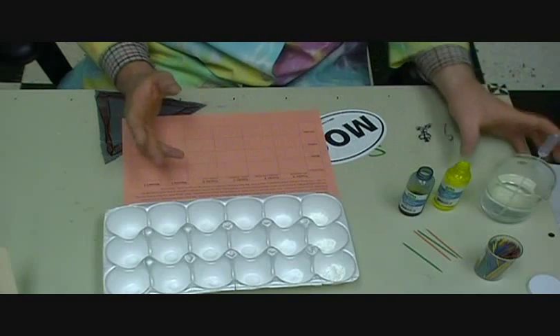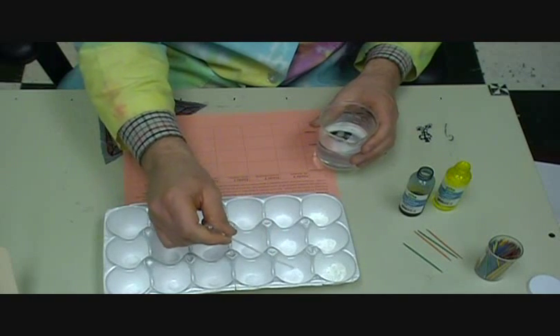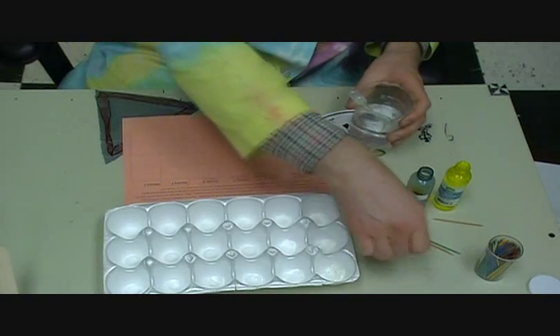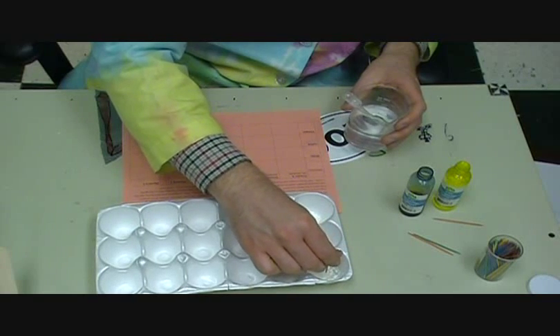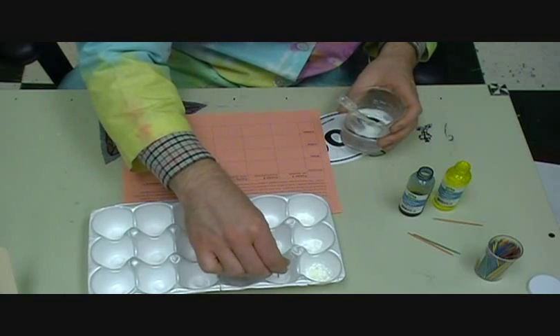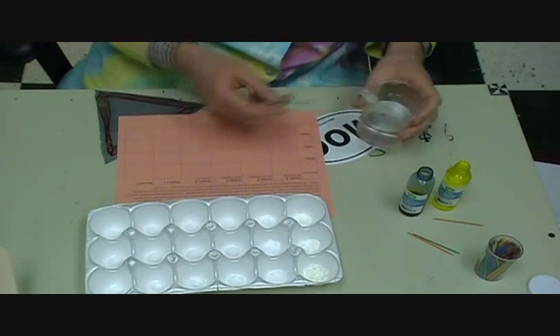Now the first liquid it says to add is water, and so the kids are just going to take a pipette and they're going to add water to this one, water here, water here, water here, to the 4, and then take a toothpick and kind of stir it around. All right, what does it look like? Oh, it gets kind of hard, almost forms a liquidy, solid type thing. This one just, I don't know. Maybe it dissolves more than A, and then mix around, and have them make their observations, write down their observations.